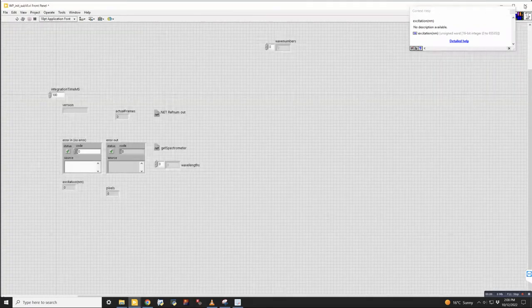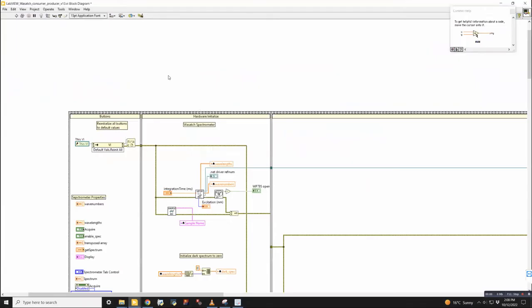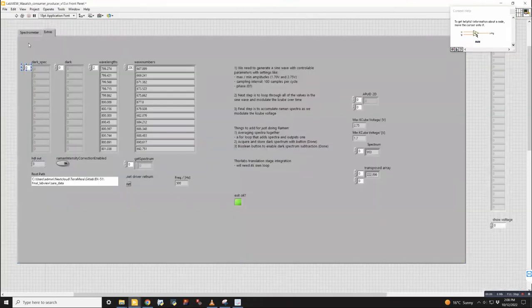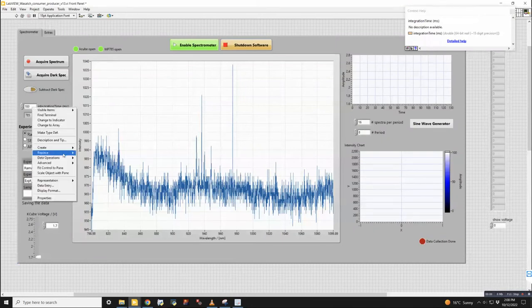So we would go, this is the sub VI. Anytime I'm closing a sub VI and I've kind of clicked around in it, but I don't want to do anything, I just defer the decision. I don't deal with it. So what you would have to do is over here in the front panel, you would change this to some other number, and then you would do data operations, make current default.